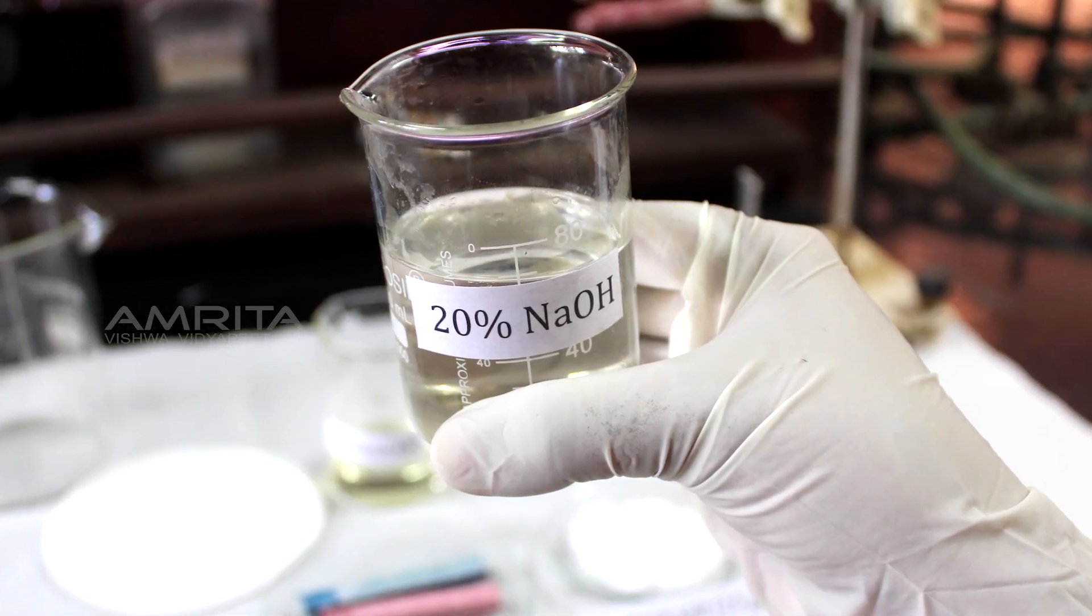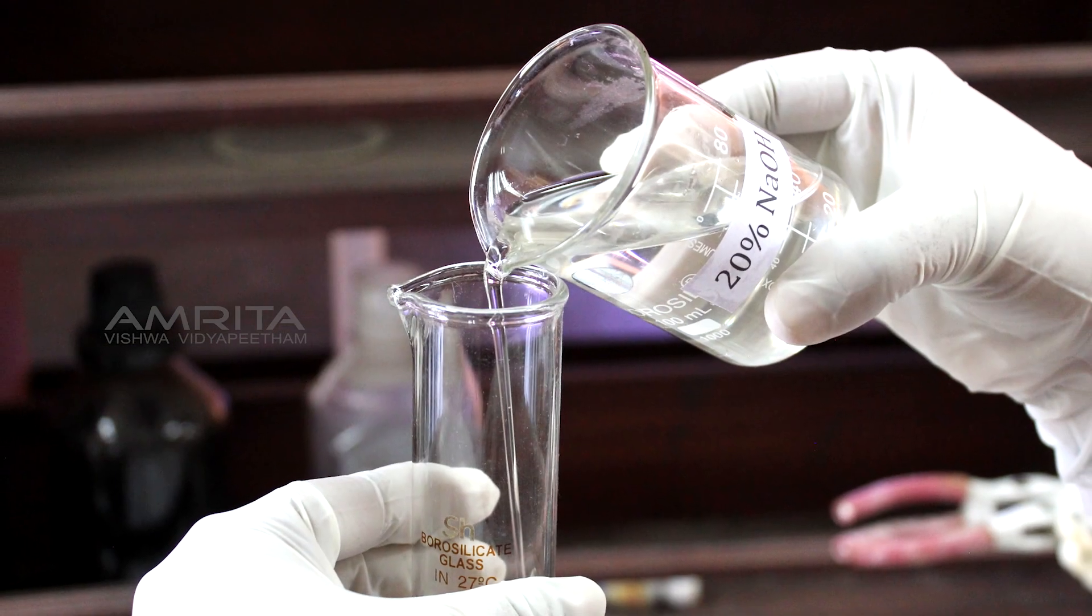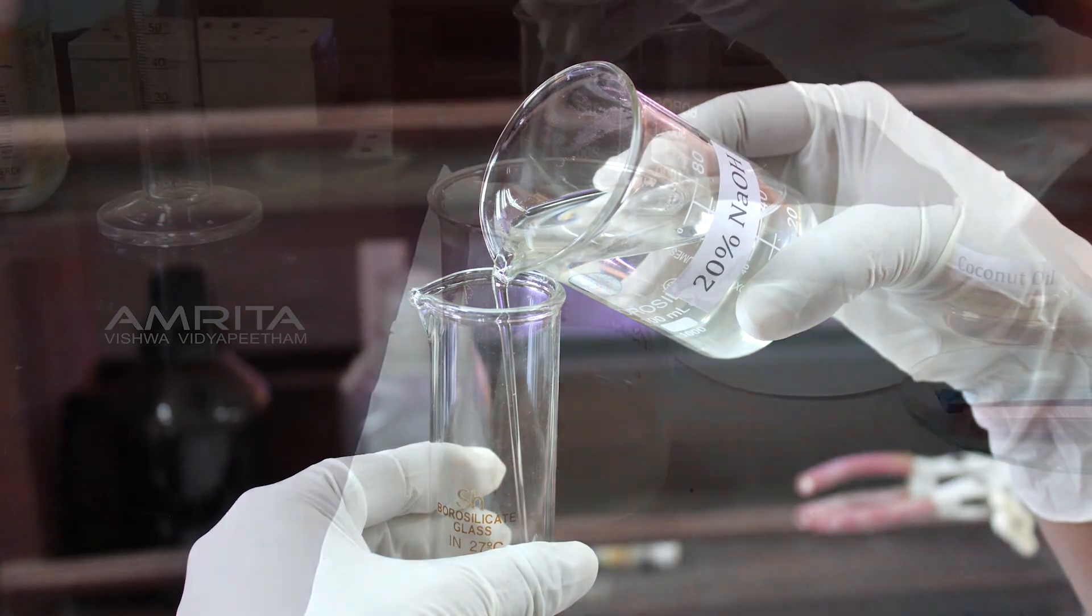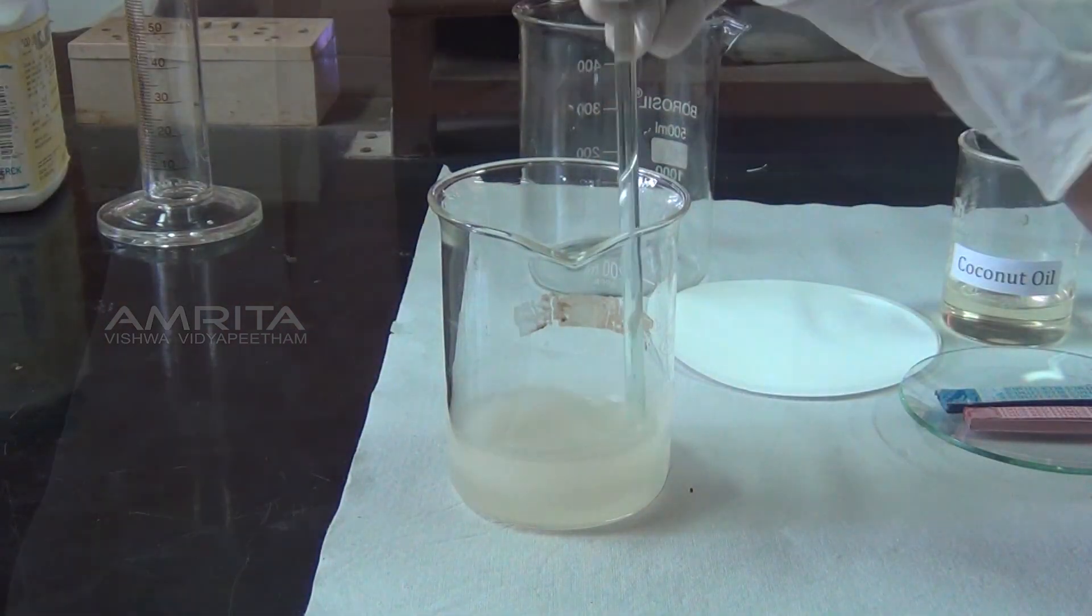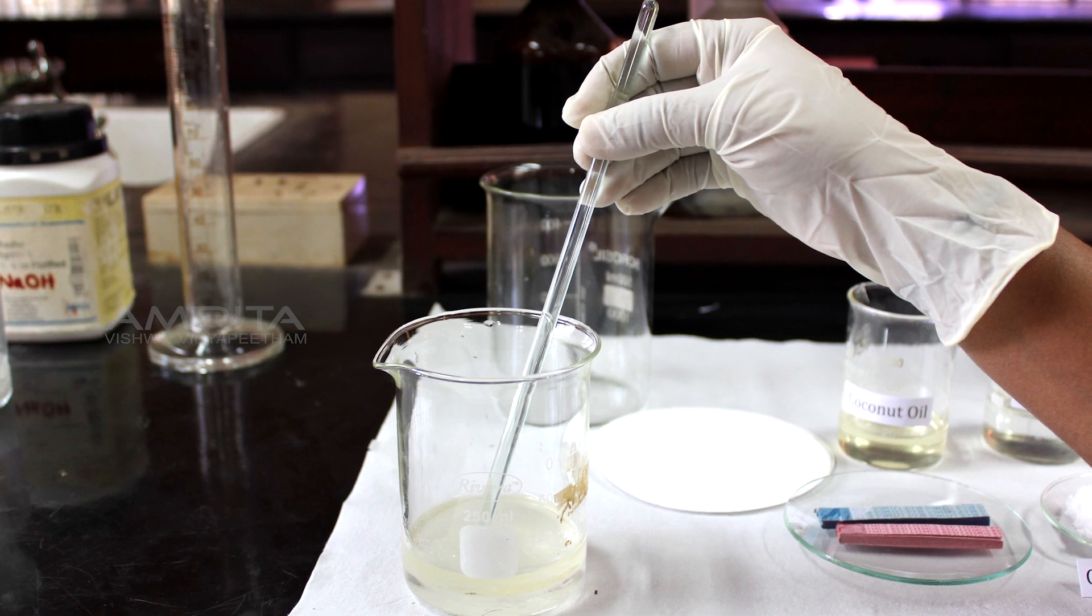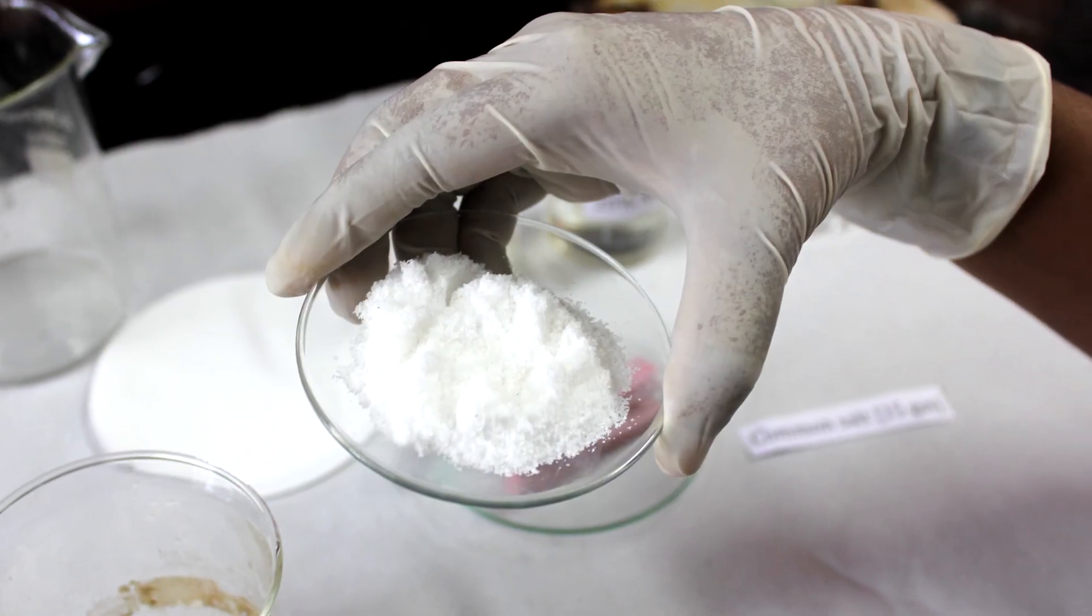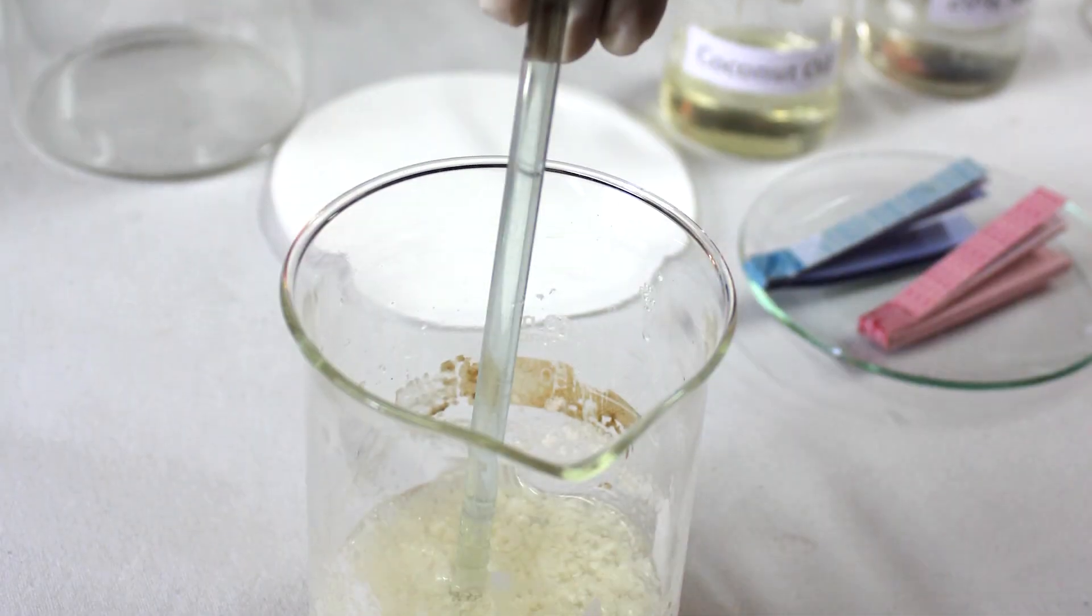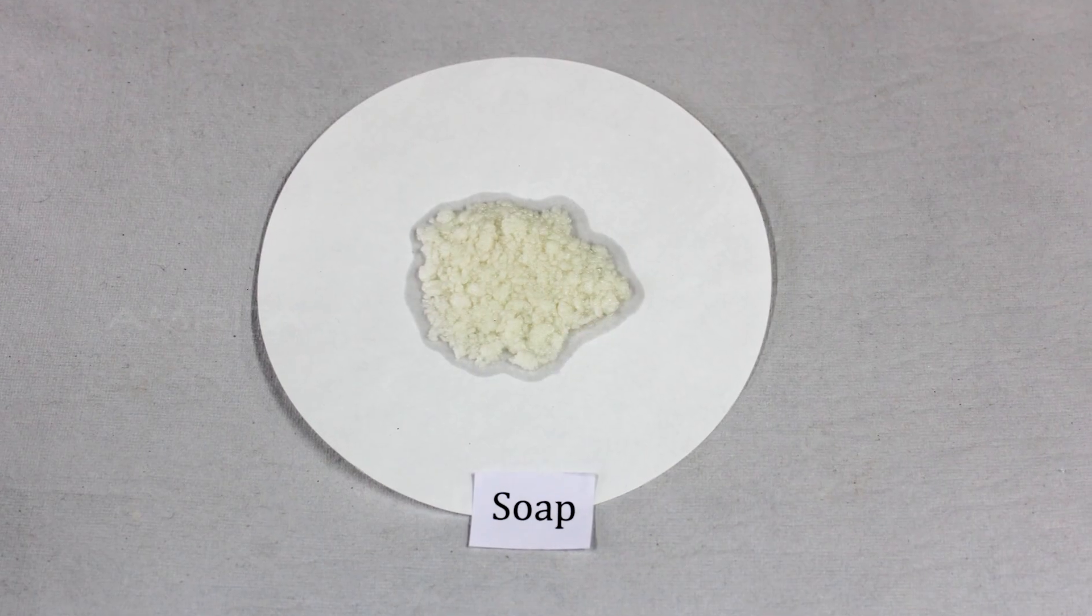Precautions: Do not touch the NaOH solution with bare hands as it may burn the skin. The mixture of oil and alkali should be stirred thoroughly. It is necessary to stir the soap solution after adding common salt to it in order to precipitate out the soap in solid form.